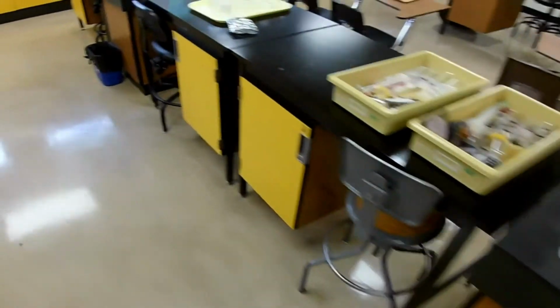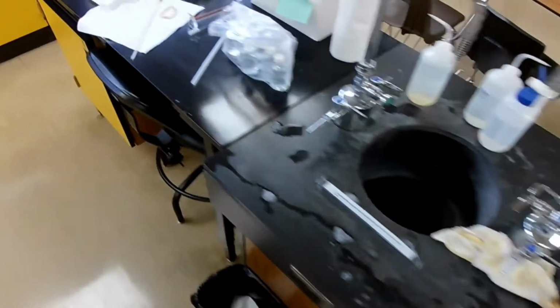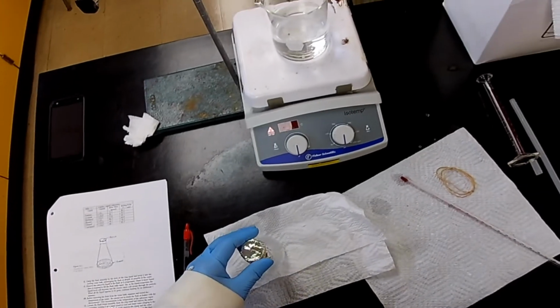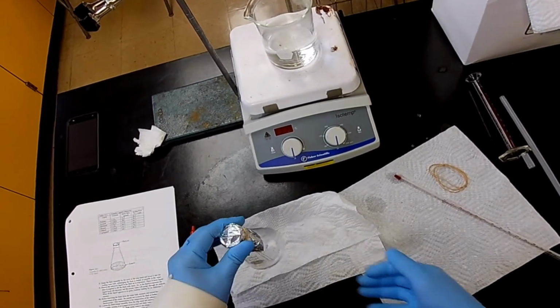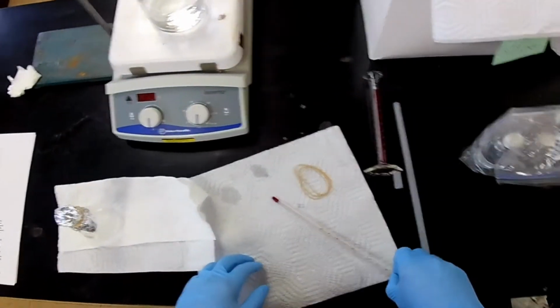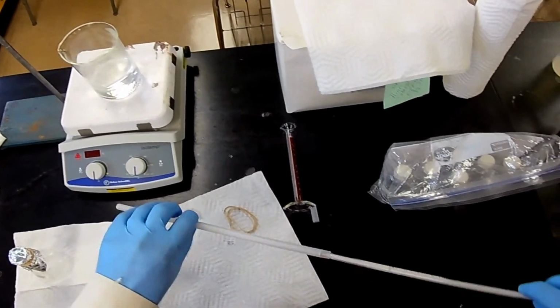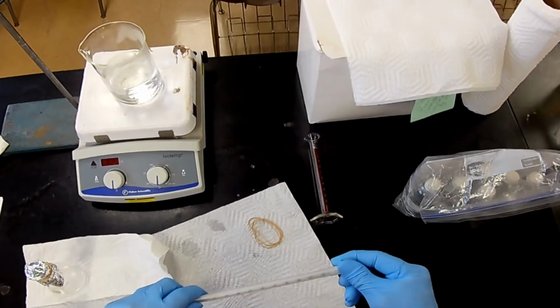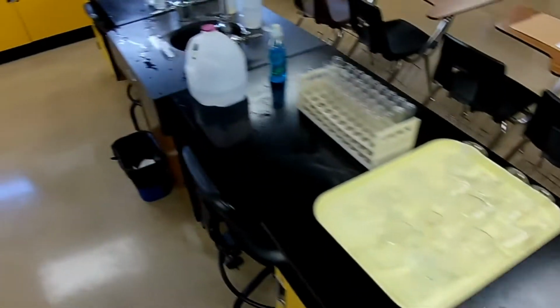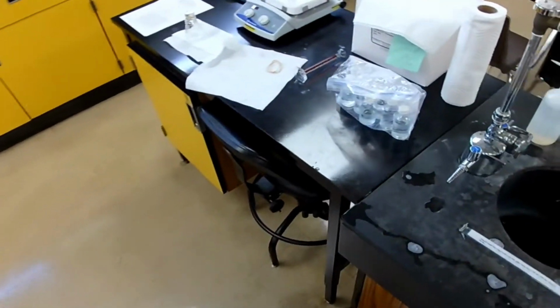Here we go. My goodness. Staying warm a long time. All right, we don't need this anymore. And here it goes.